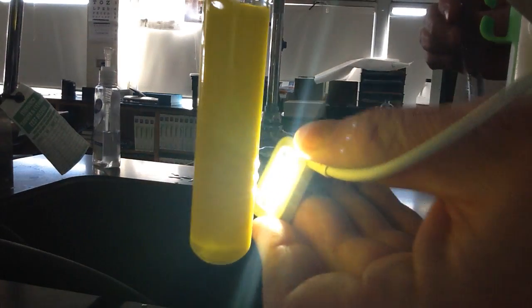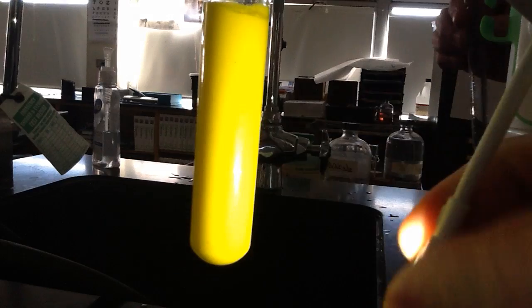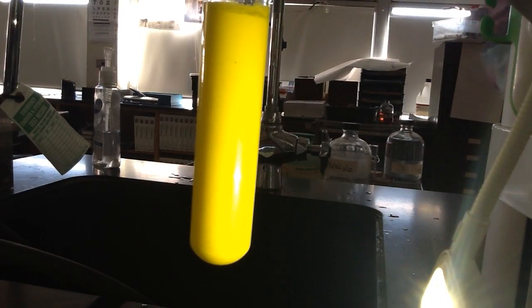It's so pretty, it is ugly. Look at that color. Look at that color. You're telling me that's ugly?